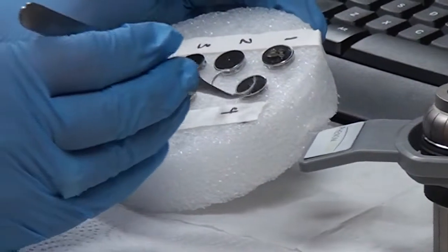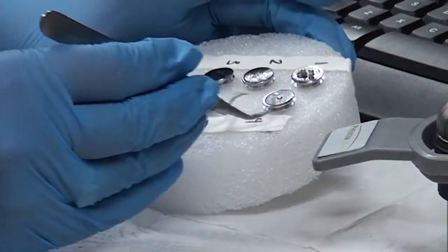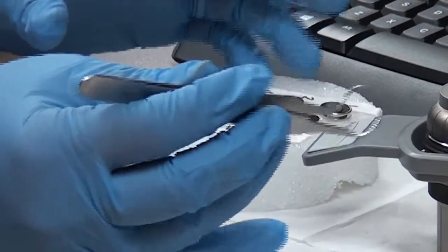After preparing the sample, we mount it on the sample holder. This is the sample holder.